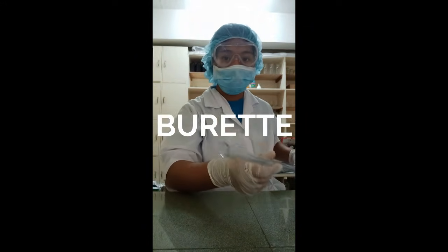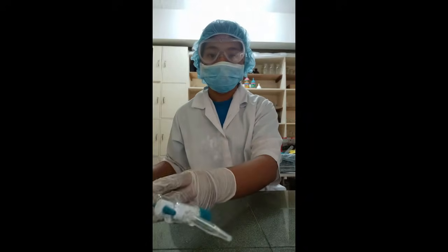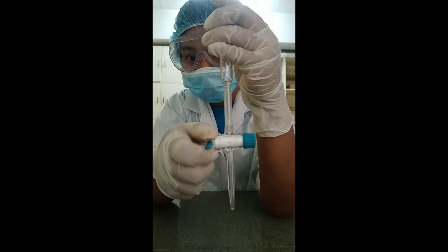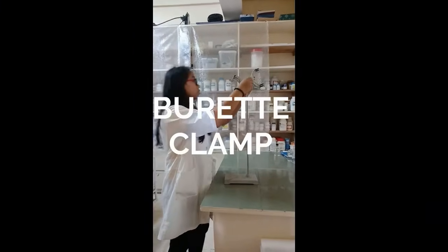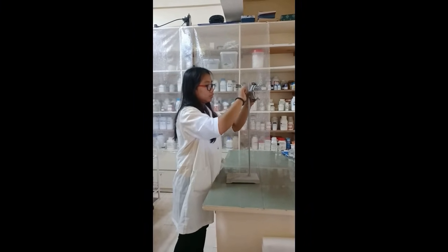Burette. It is a glass tube that is open at the top and comes to a narrow pointed opening at the bottom. The bottom opening is a stopcock that can be turned to control the amount of liquid being released. It is used for extremely accurate addition of liquid. Burette clamp. It is used to clamp onto a ring stand to hold and secure the burette.